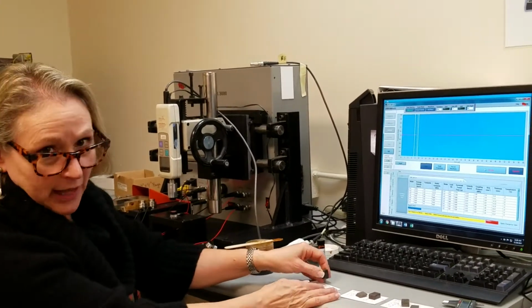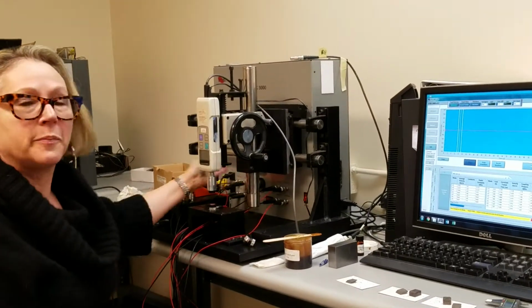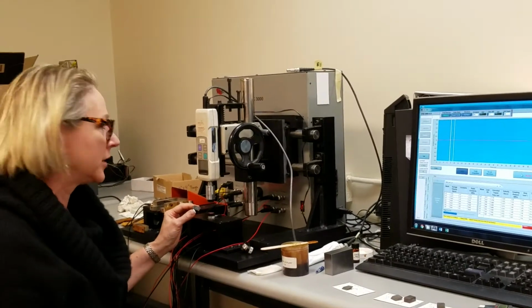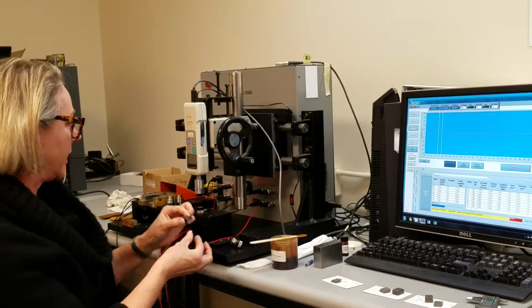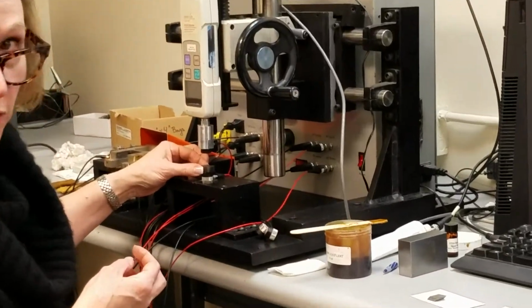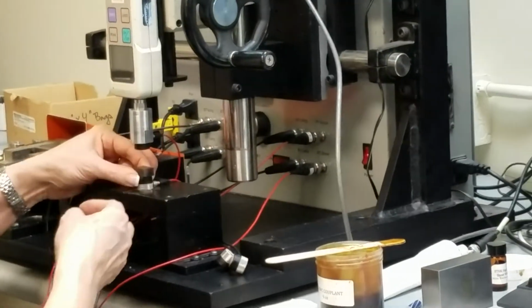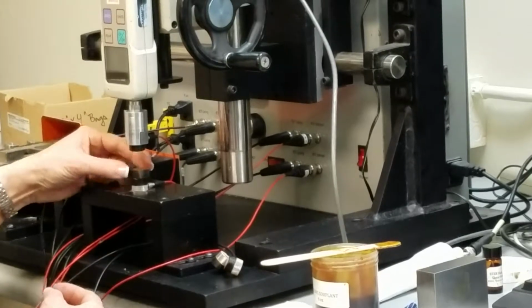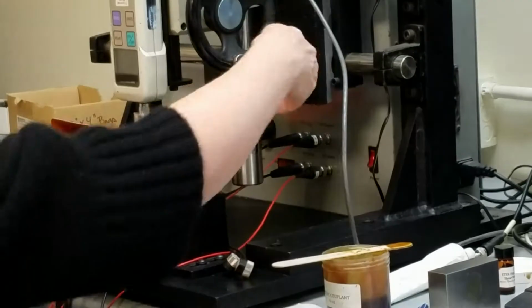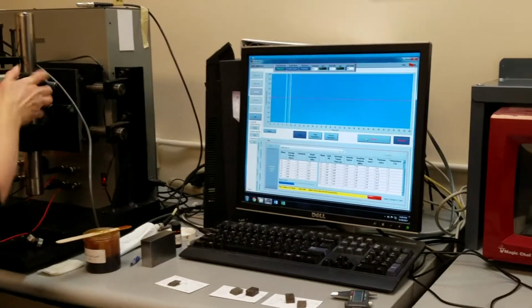Now that we've completed the longitudinal measurements, I changed my transducers, flipped my toggle switch so that we're going to be measuring with the shear wave transducers, and I will put my sample in. Again, with the shear wave, we need to be conscious of the orientation of the stems. So the 3-2, just as when we made a load measurement, the sound wave goes through the 3 direction and the stems are parallel to the 2. And the prompt says 694 newtons.